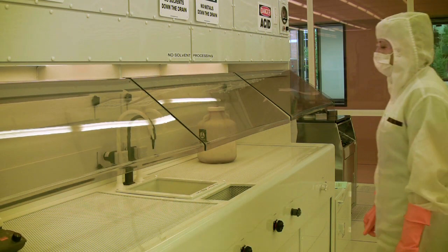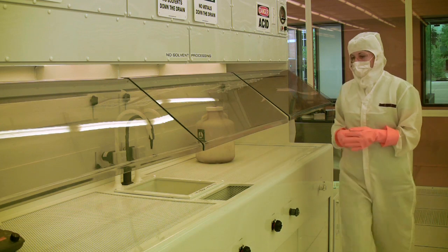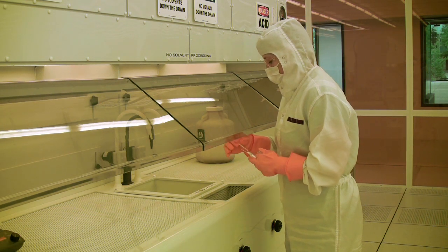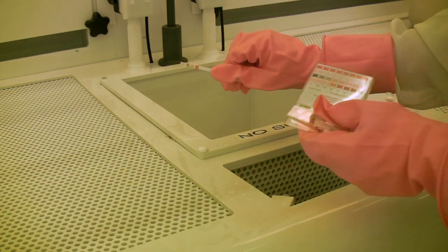You should also inspect the work area inside the fume hood for any spilled chemicals. Because there is a sink inside the hood, it is quite common for there to be droplets of water on the surface of the wet bench, but you should never assume that something is just water. If you come across any liquid on the wet bench, you should perform a pH test using one of the test strips located on the shelving unit attached to the fume hood. This should be done using acid gloves.